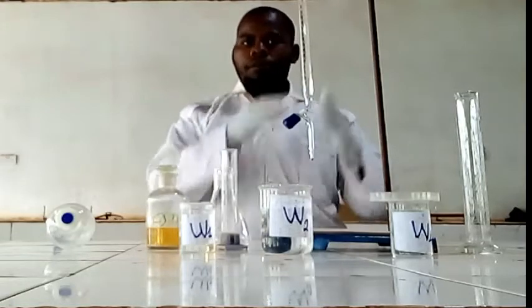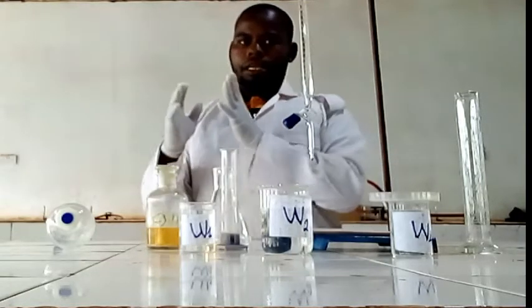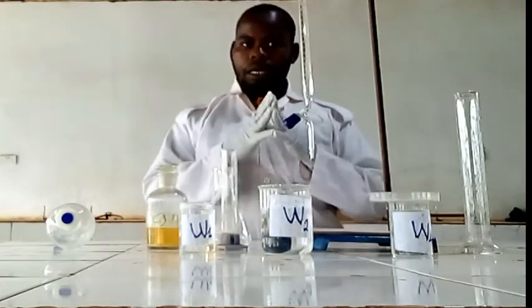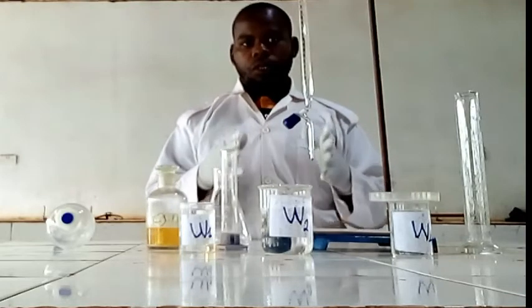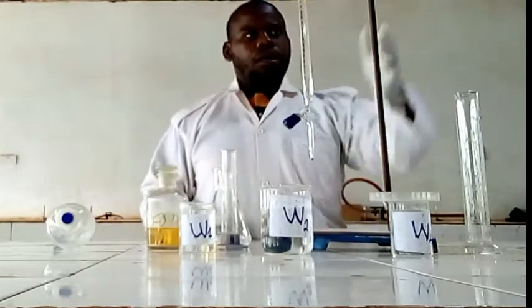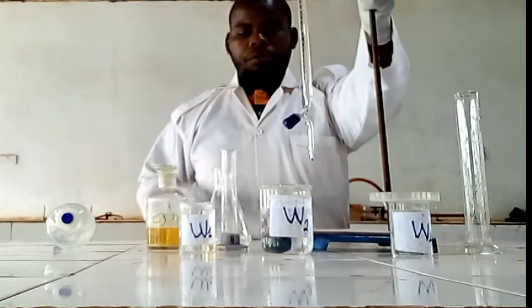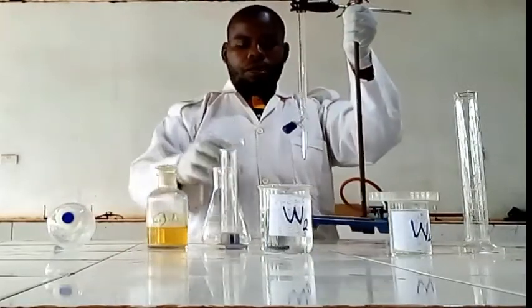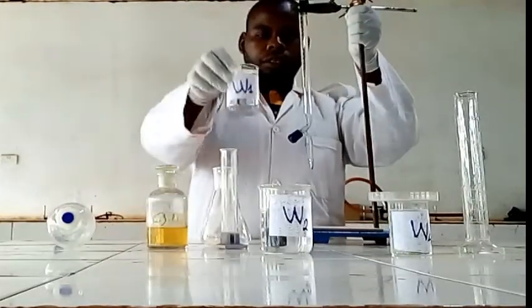Okay, welcome to our lesson. Today we are going to show you how to perform this titration for the first procedure and the second procedure, procedure A and procedure B. So let's go direct to our experiment to find the concentration. For the first procedure, or procedure A, we fill the burette with sodium hydroxide, or solution W1. This is W1.